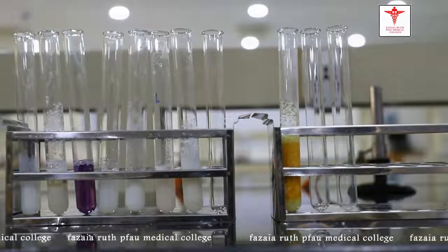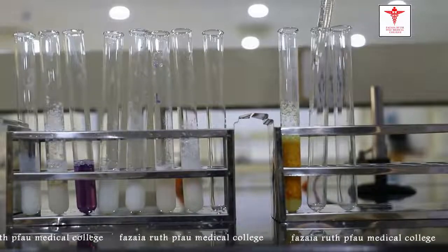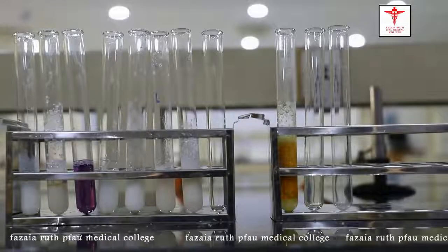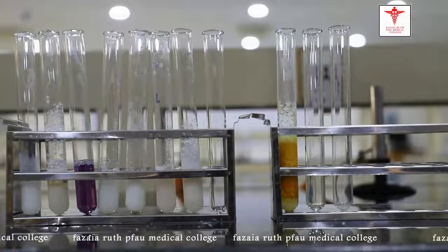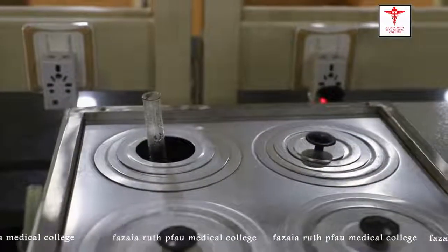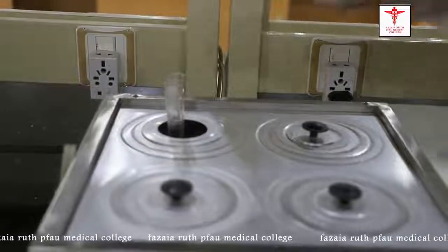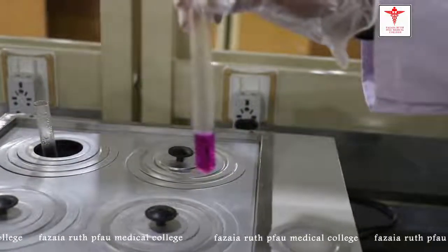Next we have Millon's test for tyrosine. We take 5 ml of original solution and add 3 drops of Millon's reagent, then boil it for around 3 minutes. After taking it out, a change in color towards reddish pink confirms the presence of tyrosine.